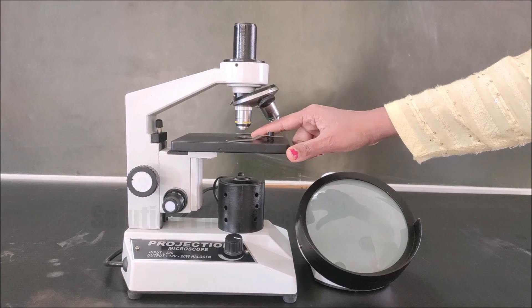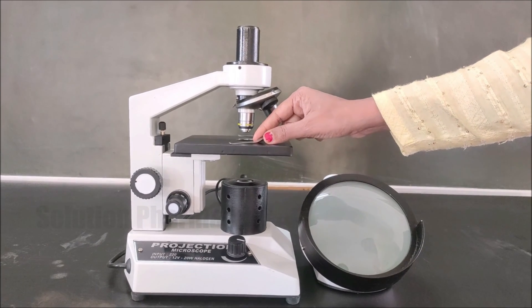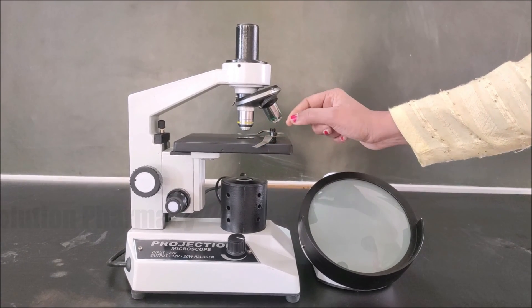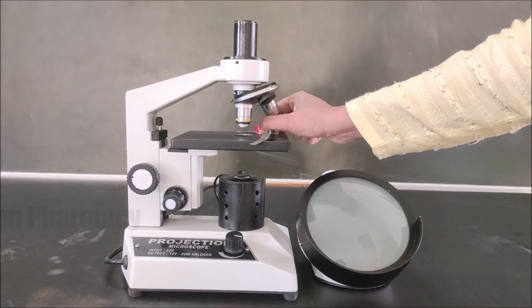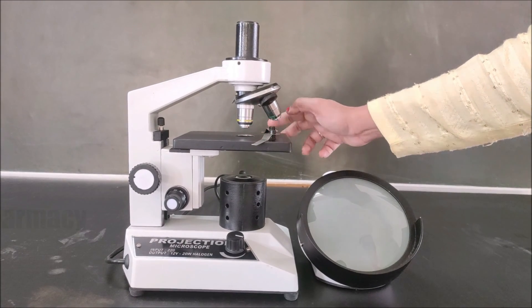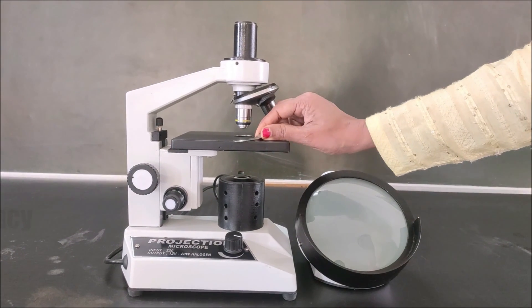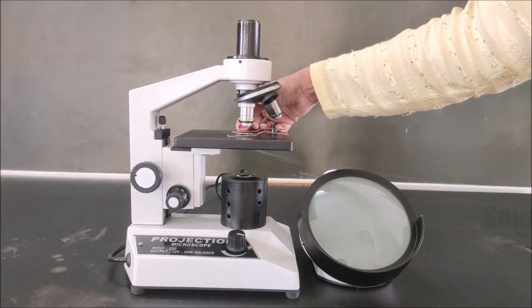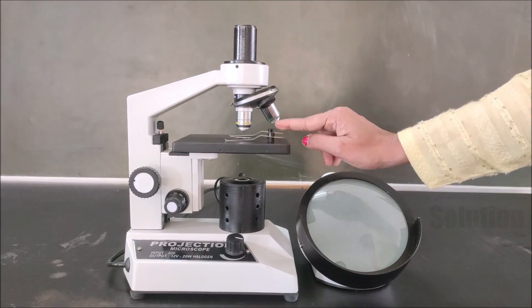Two clips are provided on the stage to hold the slide in place, so that during focusing or operating the projection microscope the slide remains in position and does not move over the stage.